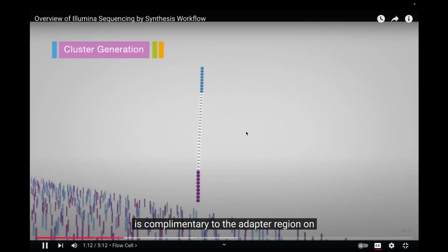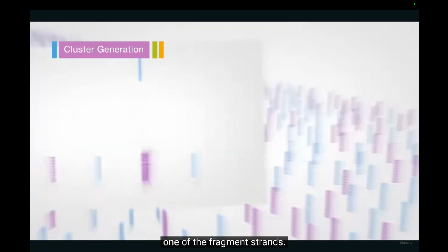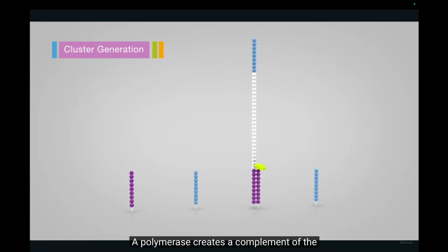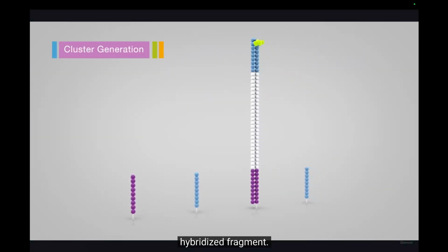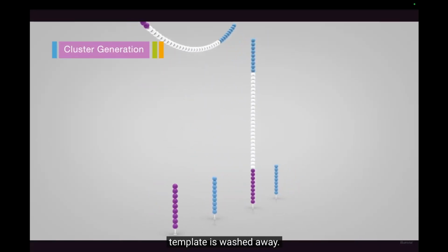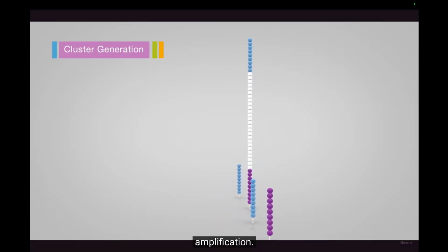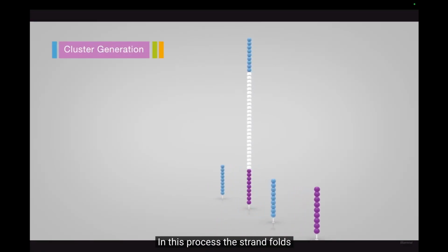This oligo is complementary to the adapter region on one of the fragment strands. A polymerase creates a complement of the hybridized fragment. The double-stranded molecule is denatured, and the original template is washed away. The strands are clonally amplified through bridge amplification. In this process, the strand folds over.